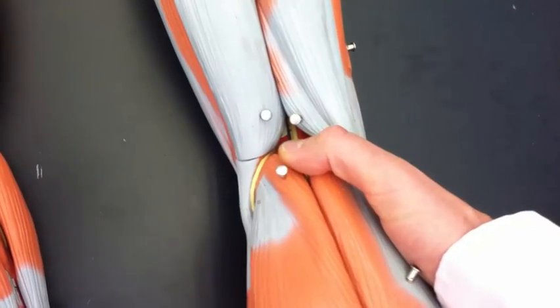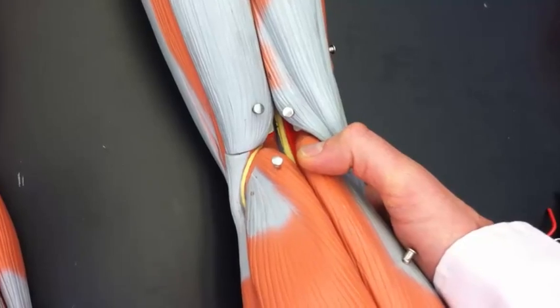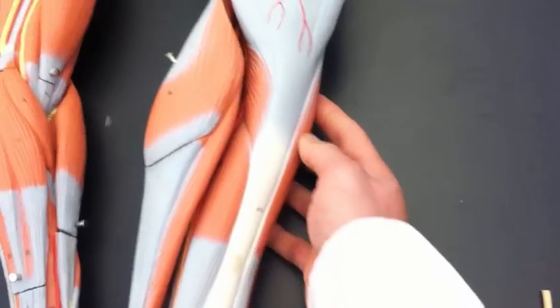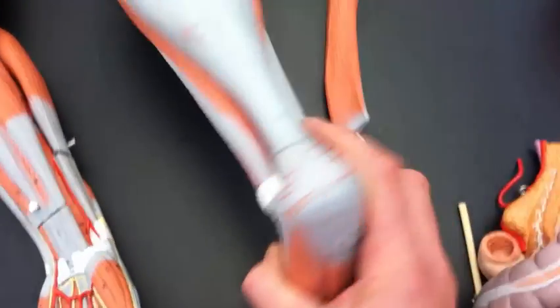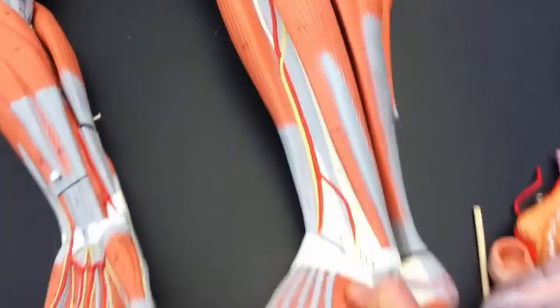Go to the back of the knee here and look inside, and that's the popliteal region. So at this region, the artery would be the popliteal artery, and the vein would be the popliteal vein. Going down towards the bottom of the leg, if I pull off this muscle, we can see the anterior tibial artery, so this would be the left anterior tibial artery. And then back here behind the tibia, we can see the posterior tibial artery. And those are all the ones I ask for in the legs.